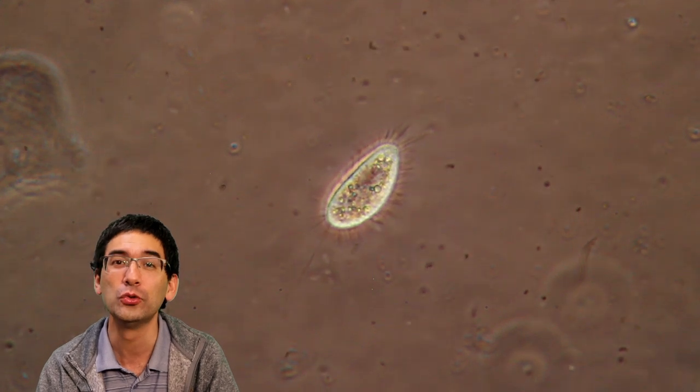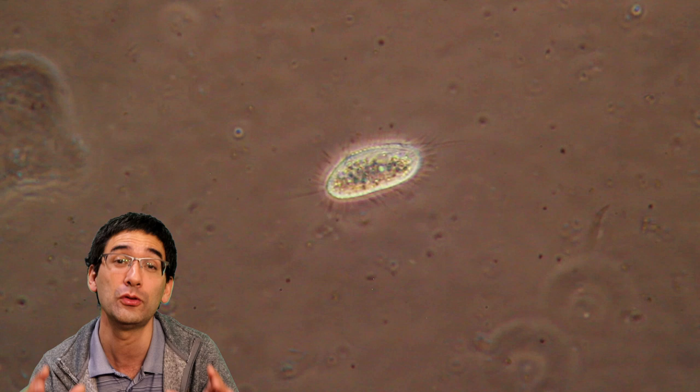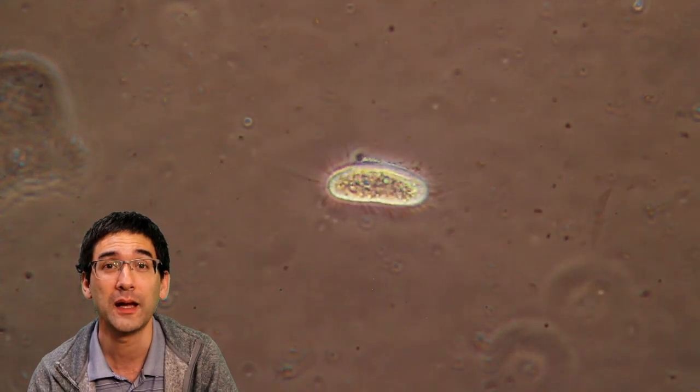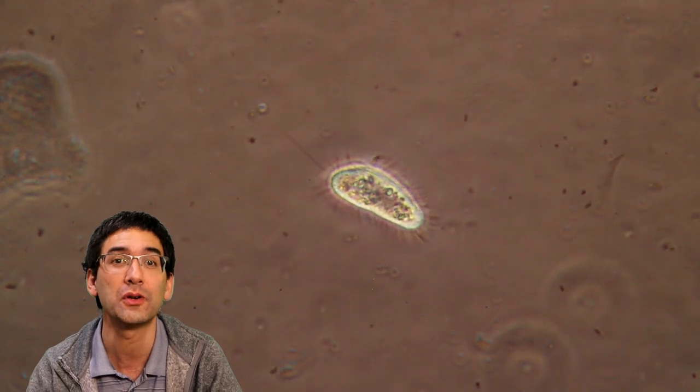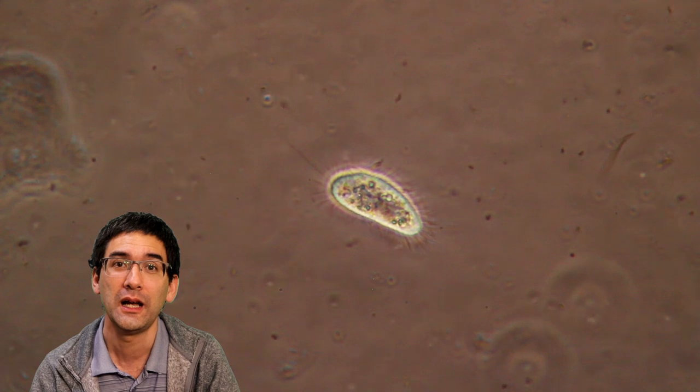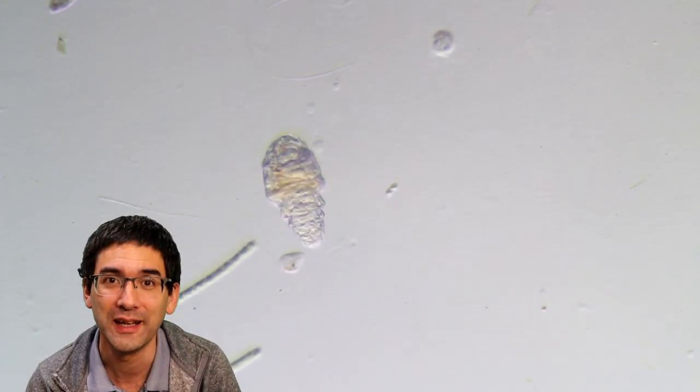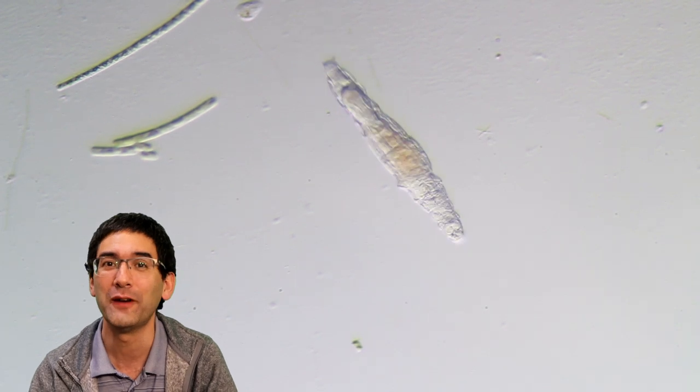I do recommend that you do not put it into direct sunlight, but into a bright place where there's lots of light. Maybe not direct sunlight because this can cause some overheating of the culture. And here again, a little rotifer moving along the microscope slide.